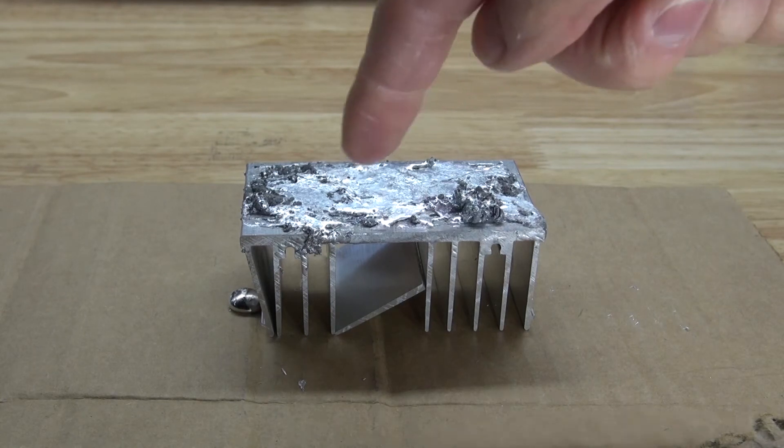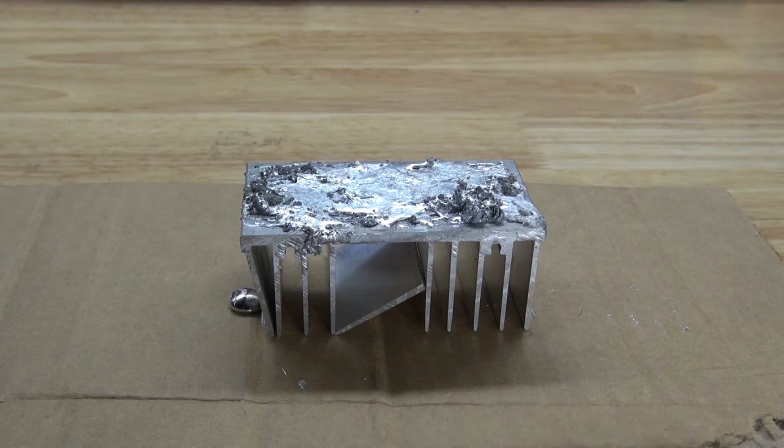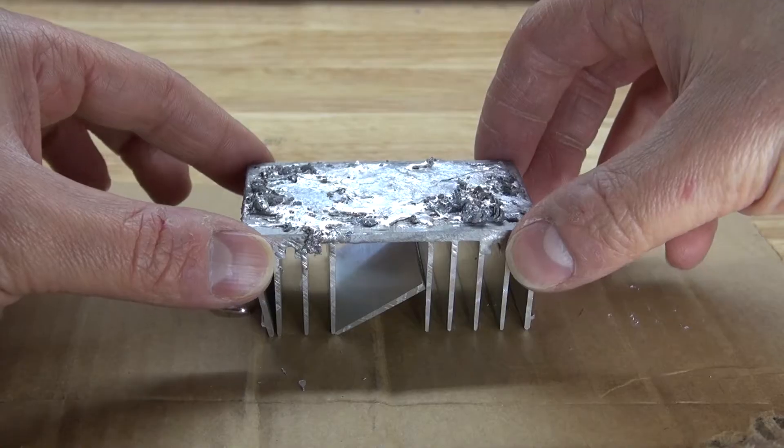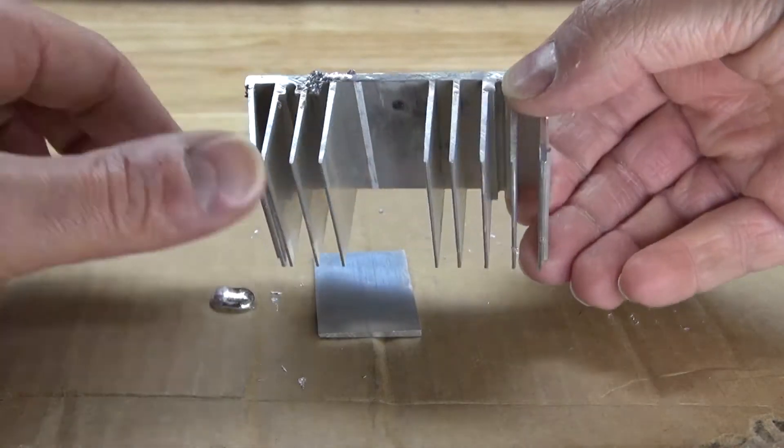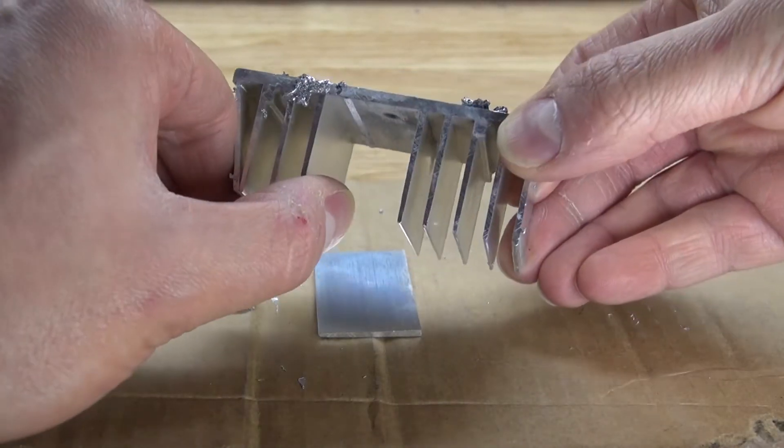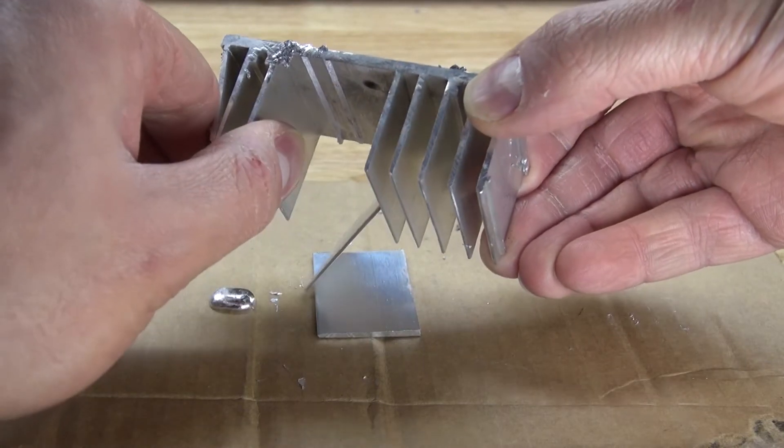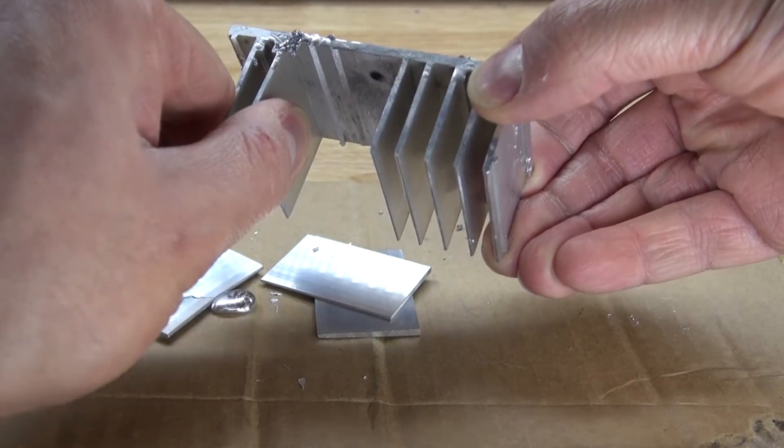Even a little piece of it fell off on its own. And as you can see, as I pick it up, it already is falling apart. Takes no effort to break, just like that.